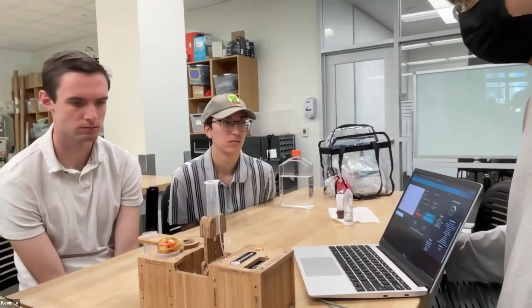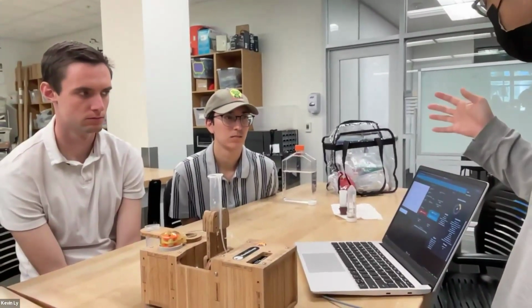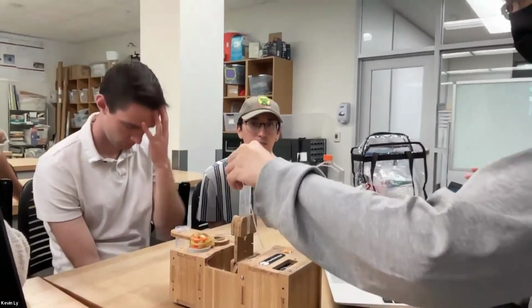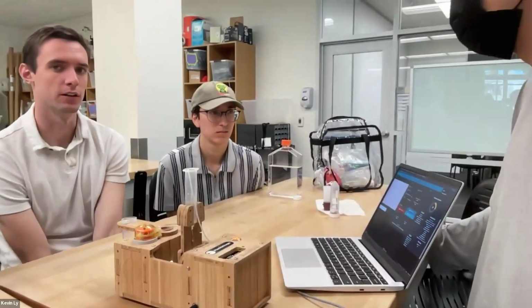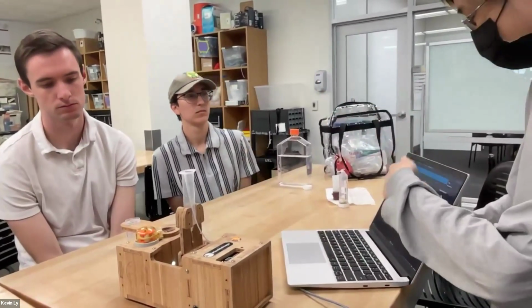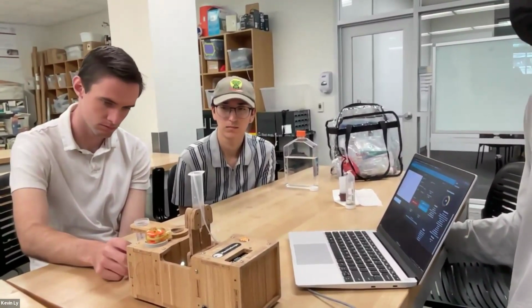What we'd like to do is move towards something where we can maybe image everything, but that's going to take a lot more work on the computer vision algorithms for detecting and isolating objects so that they can do it in real time instead of after the fact. And you have a machine learning model running on the images and identifying the objects? I think people have been doing work on that. Usually right now we collect the whole data set and then pass it into whatever scripts people have made for doing whatever they want to do.